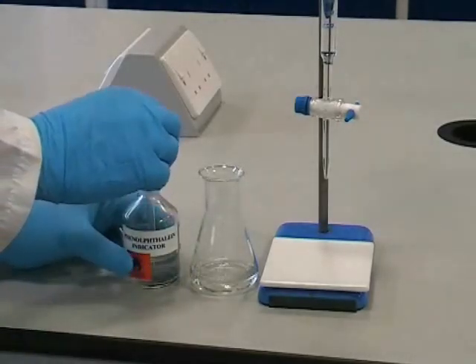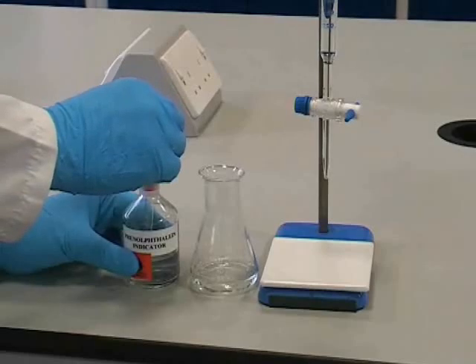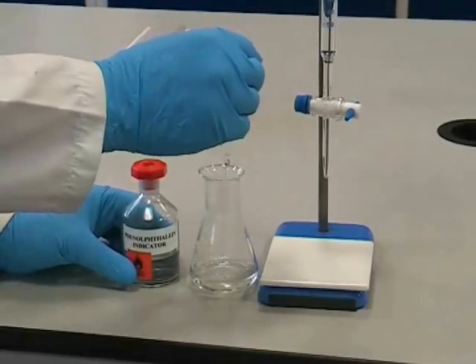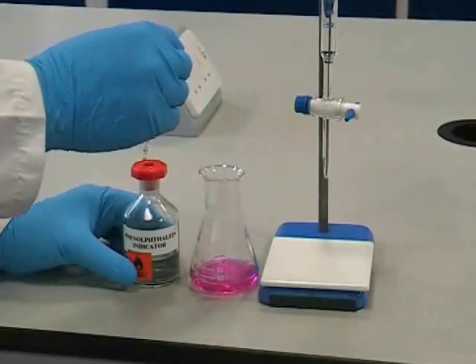Before carrying out the titration we need to add a few drops of indicator which in this case is phenolphthalein. It's important not to add more than two or three drops of indicator as you don't need it.